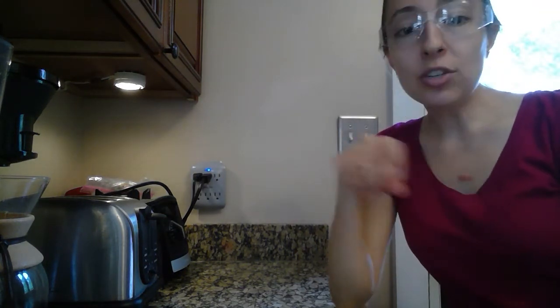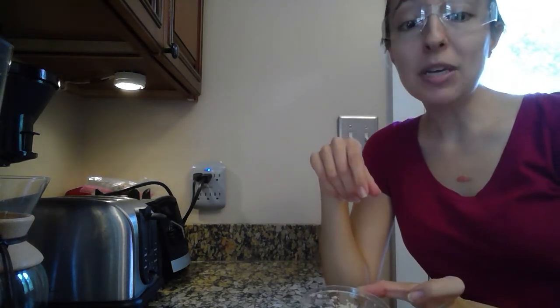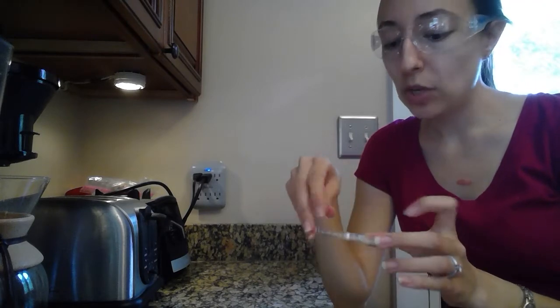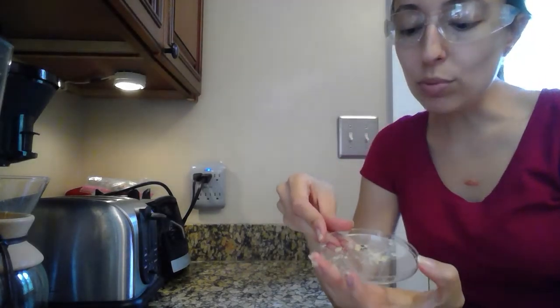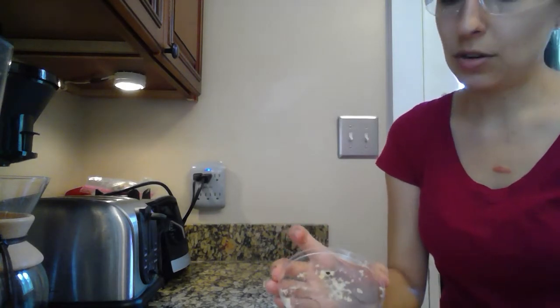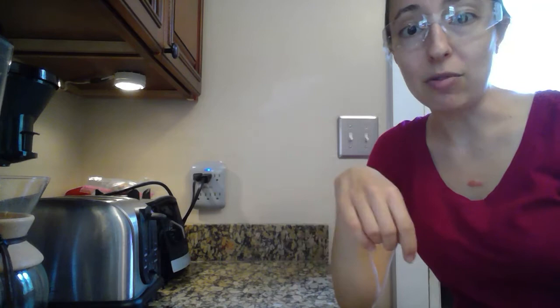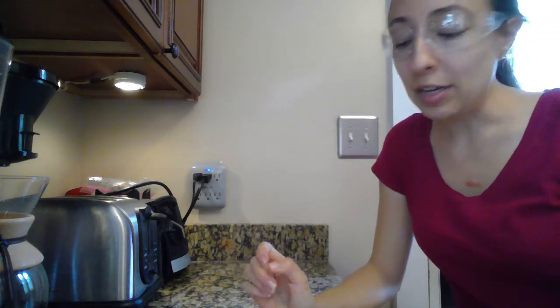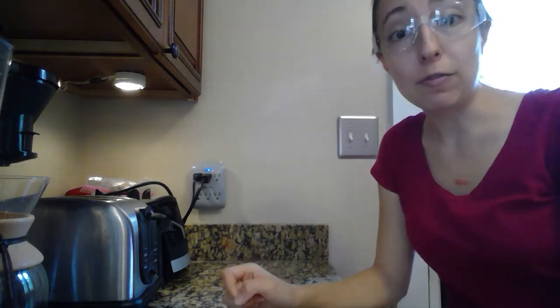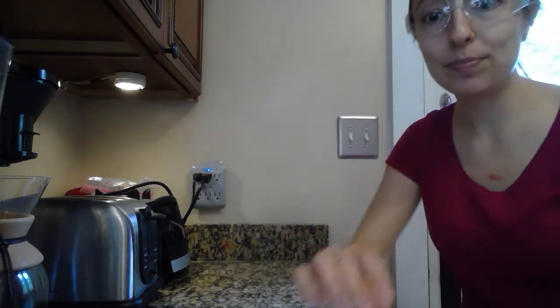Now, if the color changed with time 0, right when you put that drop on, probably means that you have a lot of starch present. So my Rice Krispies, I have this really deep blue navy kind of color. So that's showing me that I do have a decent amount of starch present in that Rice Krispie cereal. Sometimes it might take a little bit though. And so if you end up getting a color change after a few minutes, you do have starch present, just maybe a little bit less.